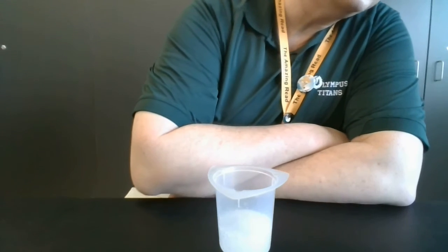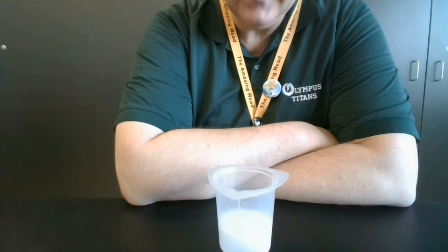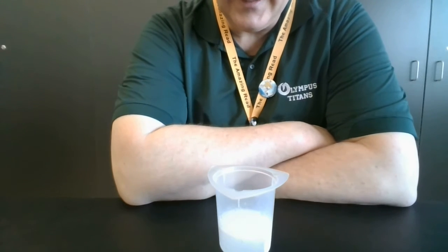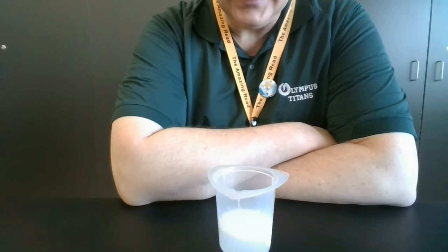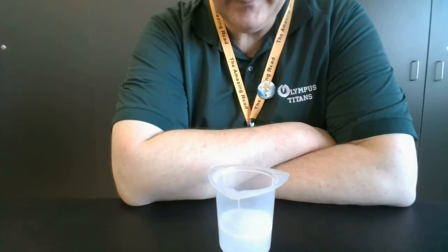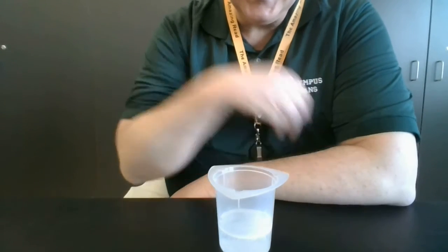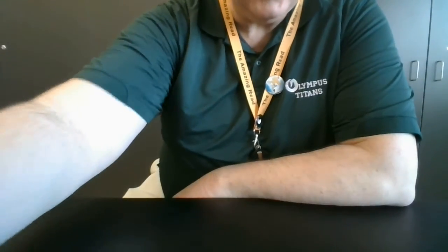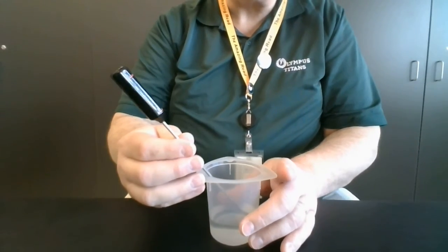Oh, and this one's going along quite a bit quicker, it sounds like, and looks like. Can you hear that? I don't know if you can hear that or not, but I definitely hear it. And that one is done. Stop timing.